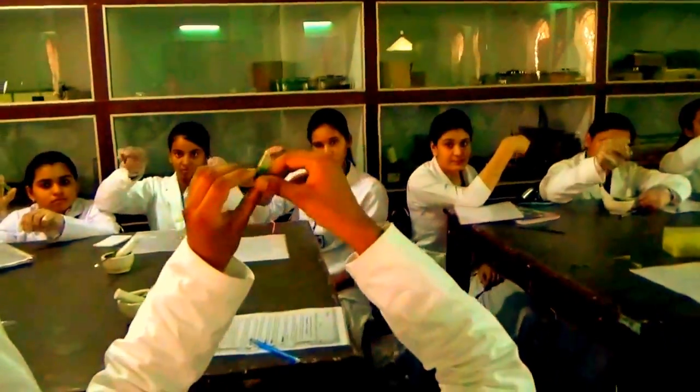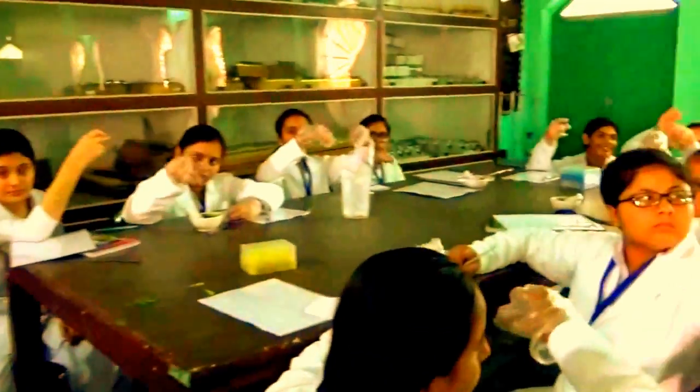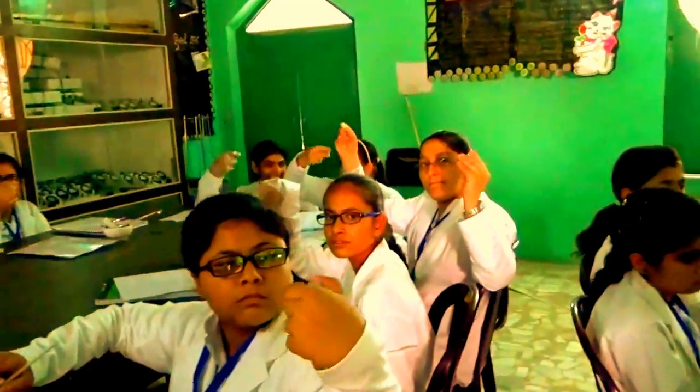So by doing this angular movement, you are creating a different angle, so that every side of the protein comes in touch with chloroform. And it gets precipitated. Right?